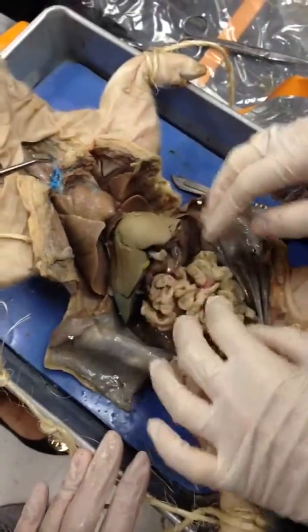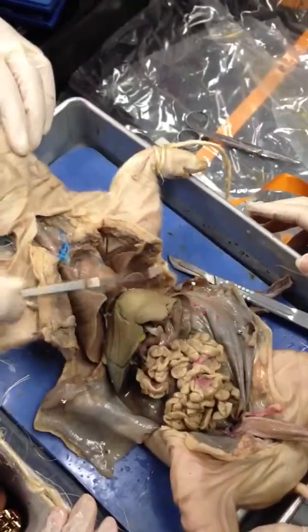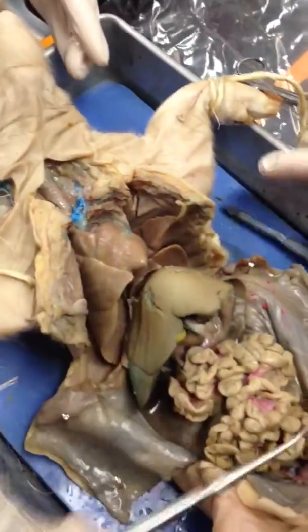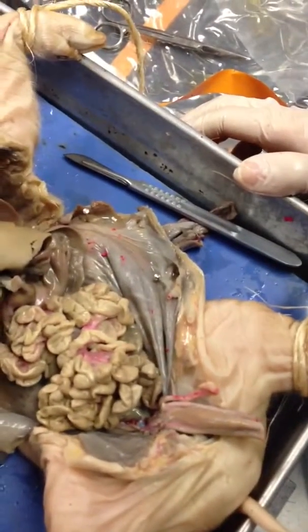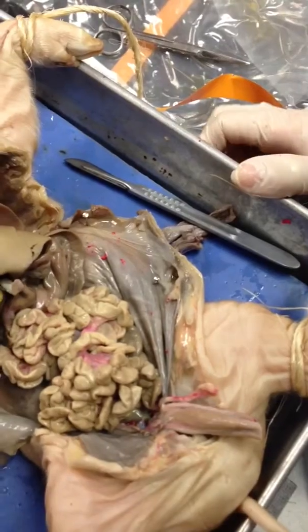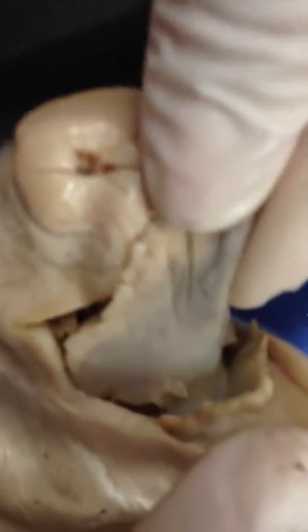At the fetal pig, Cassandra opened up the sternum, so we exposed the pericardial sac as well as the abdominal cavity. So then starting from the top of the alimentary canal, you can see we have the oral cavity, which contains the teeth, the tongue, and the lingual frenulum that attaches the tongue to the bottom of the mouth.